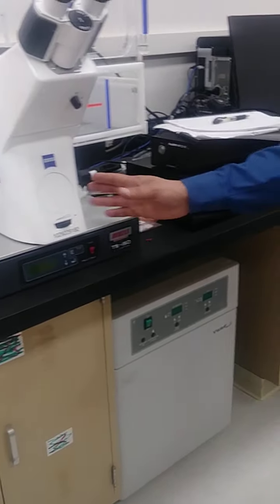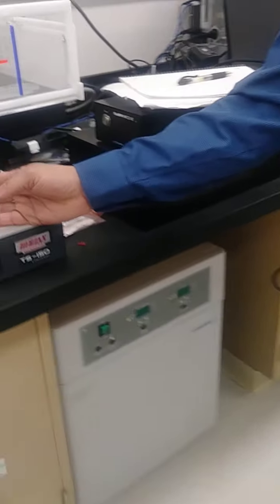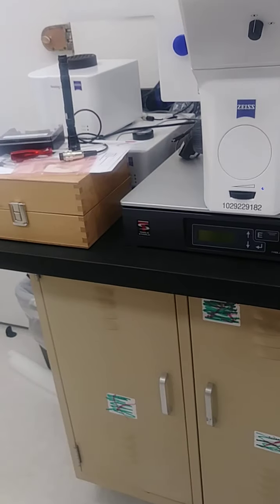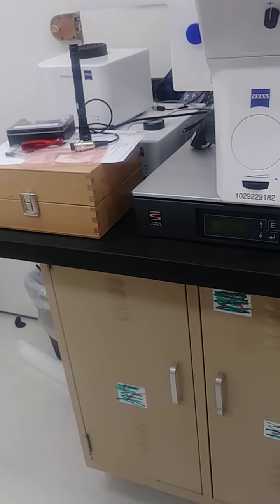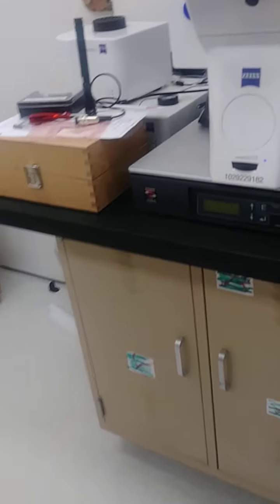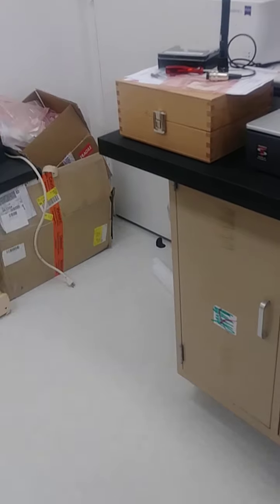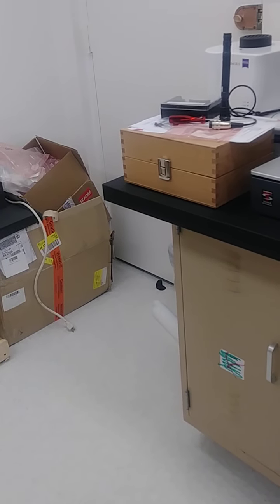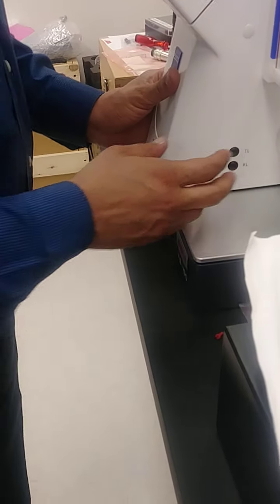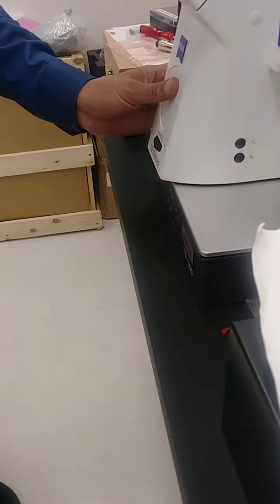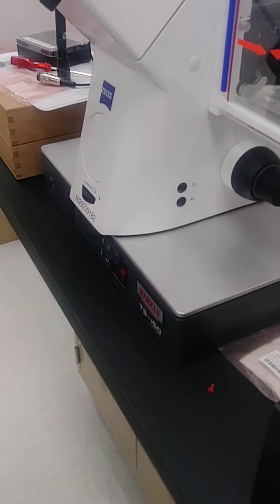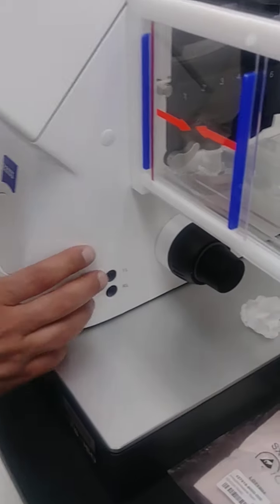So now we've let it go to the bottom. And so there's a shutter, right? Are we on the bottom? Let me make sure we're on the bottom. We're on the bottom. All right. So that's shutter. And now you can see there's a blue light.